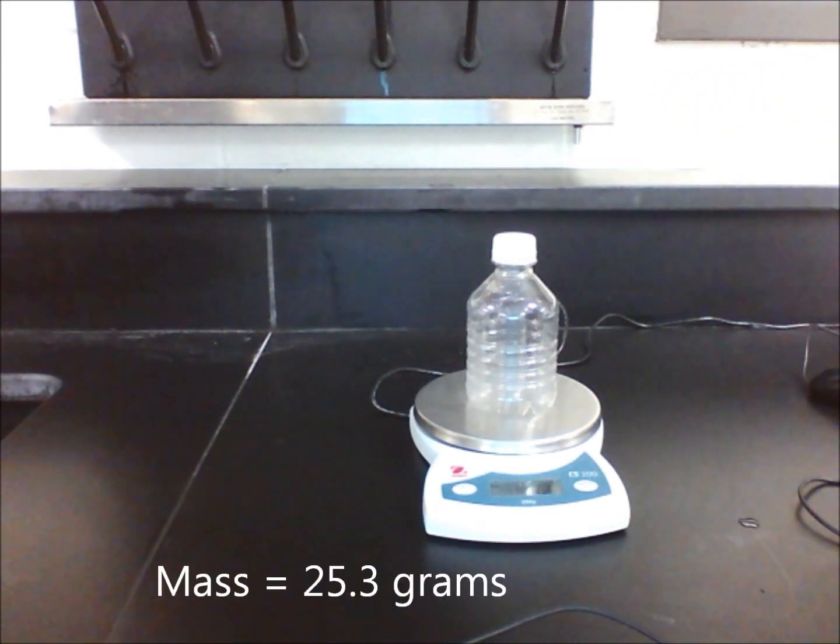Then calculate any difference in mass. There should be no or very little change in mass from a solid to a liquid.